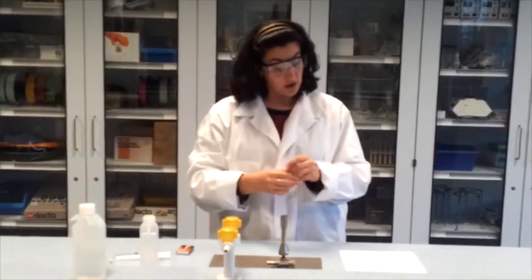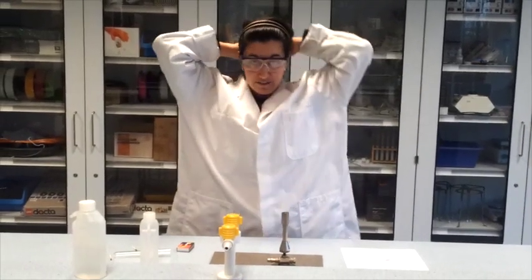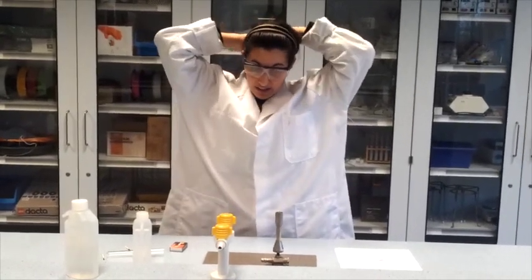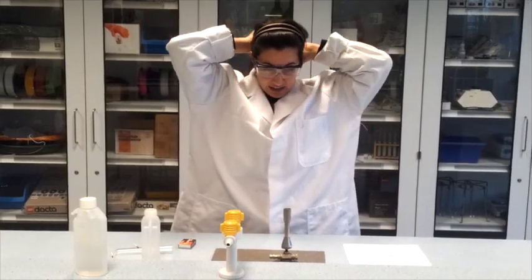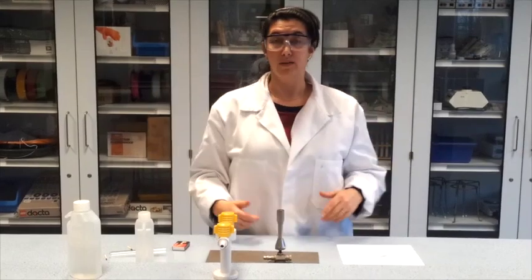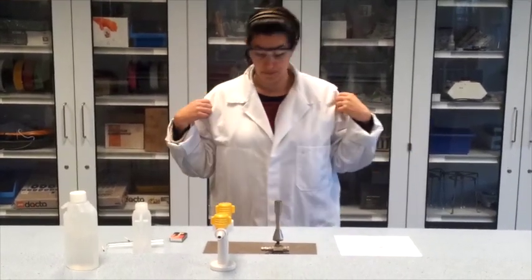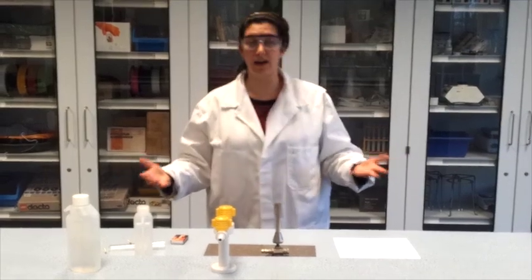Furthermore, I'm wearing my lab coat. I have to tie back my hair. Again, not very fashionable, but it avoids my hair catching flame easily if a flame comes near my face. Furthermore, are any loose items tucked away? And they are.